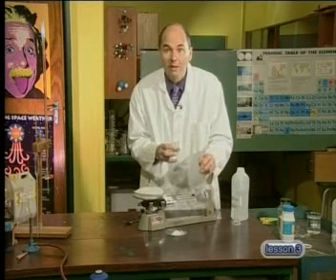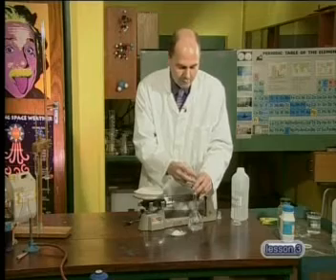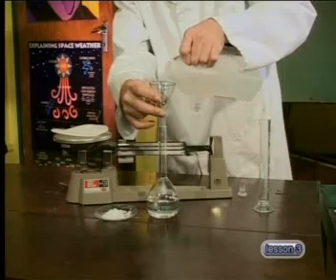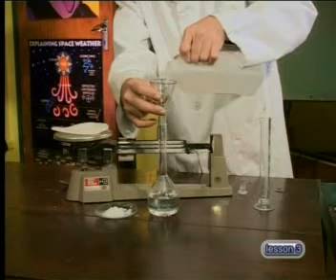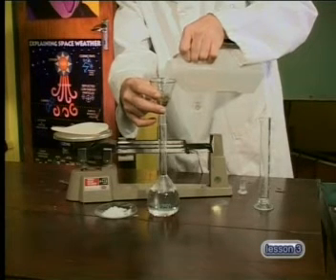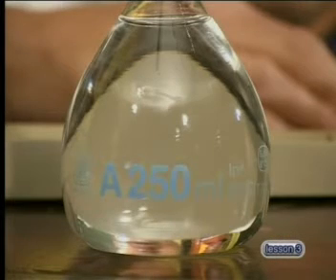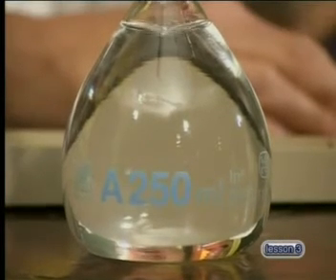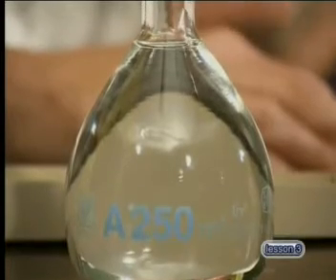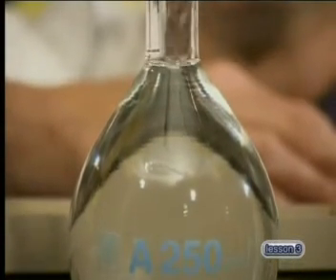All the crystals are now dissolved and I'm going to add in the rest of the water. This is the tricky part — I need to add just enough water to this solution so that it gets up to the measuring line: exactly 250 mils.